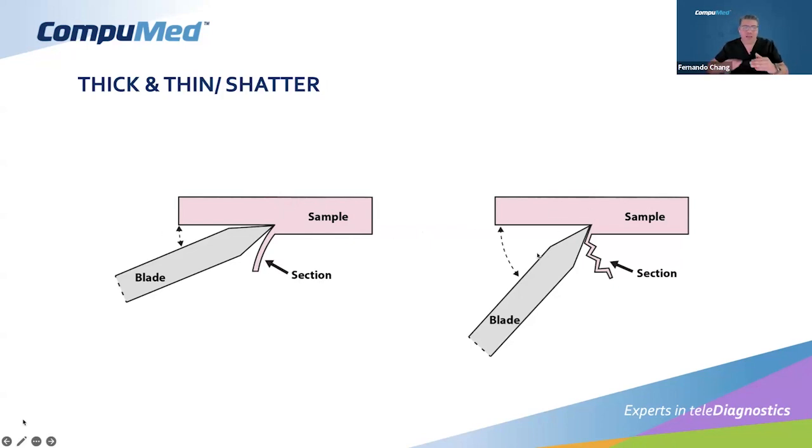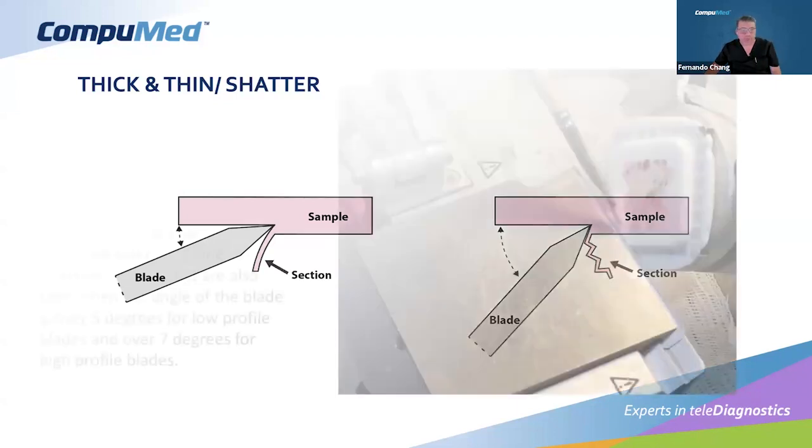But what happens if we have a different angle? If we have an angle of 7 or 8, 10, or we have moving parts, this is exactly what happens. The blade is going to start jumping because the presentation of the blade is not at this shaving angle. The presentation of the blade is more towards 45 or 90 degrees, exaggerating that, of course. So the blade is going to start jumping. And that's what we see, that wavy pattern on the sample. And the section obviously is going to have this wavy pattern as well.